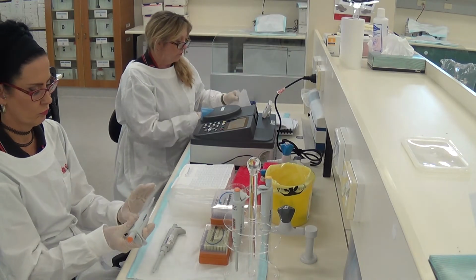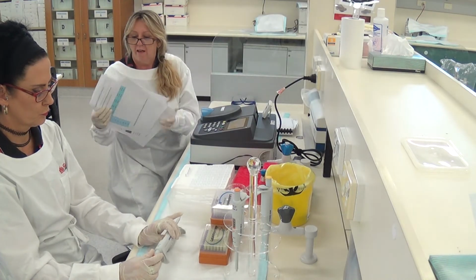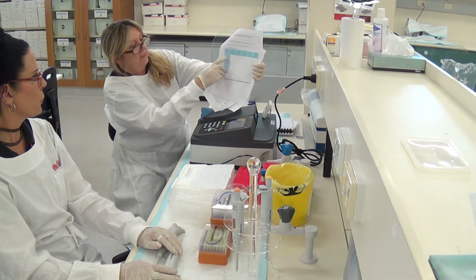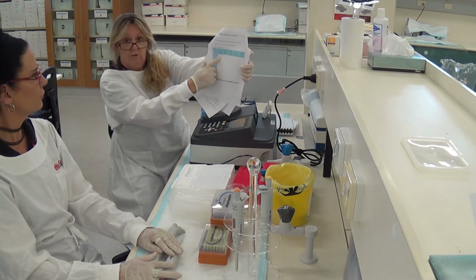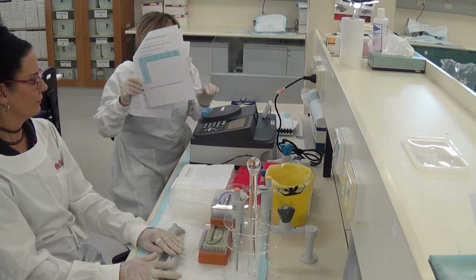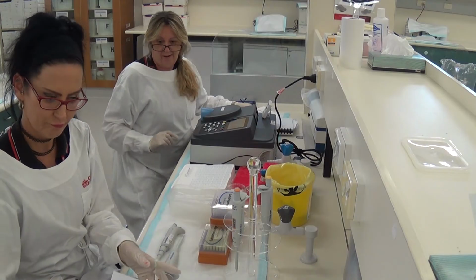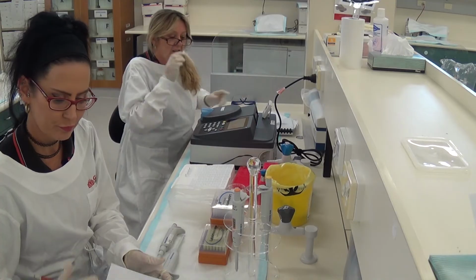So what I want you to do first of all is turn to the very last page of this printout, where it says Barb's experimental results. You will see on this table where it says time in seconds 0 at 340 nanometers, 1 molar ethanol. In that box, you're going to take a pen and write 0.036. I'll get Kat to record it as we go. So 0.036. This is our time 0.